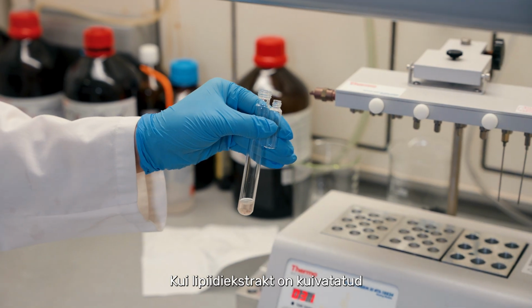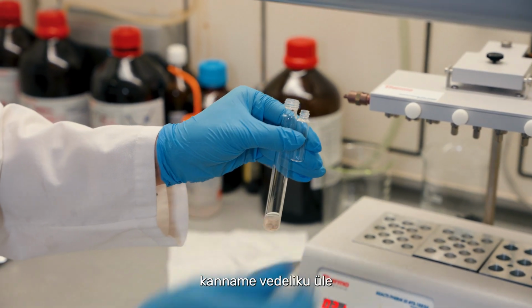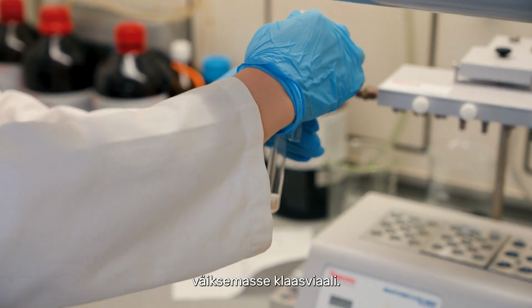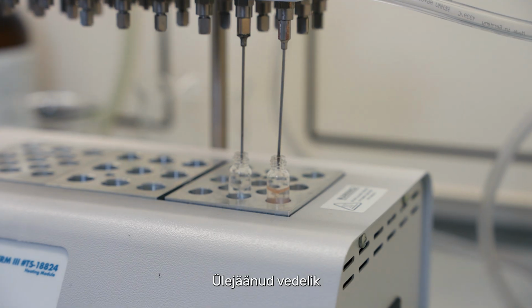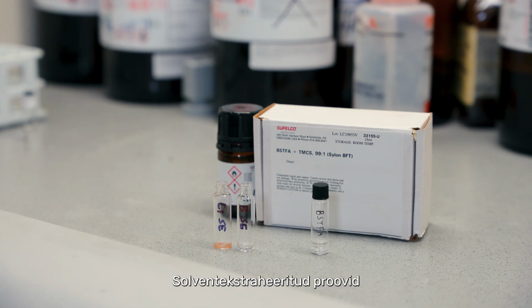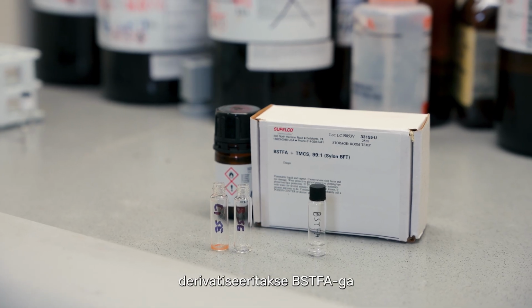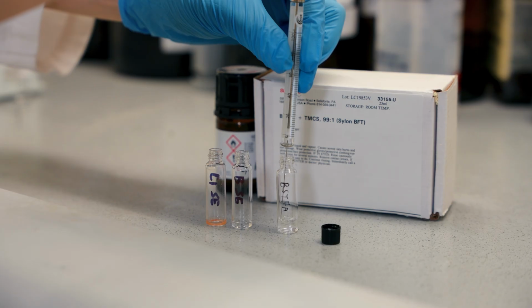When the lipid extract is dried down until 2 ml level, we will transfer the liquid to a smaller glass vial, and the leftover liquid will be further dried down under nitrogen. The solvent extracted samples will be further derivatized with BSTFA to be silylated.